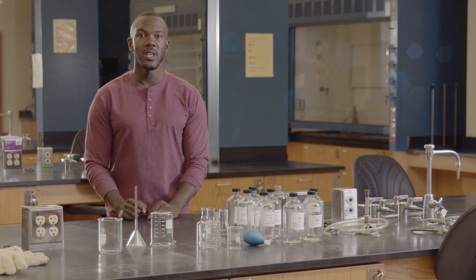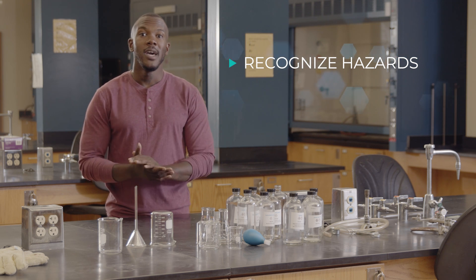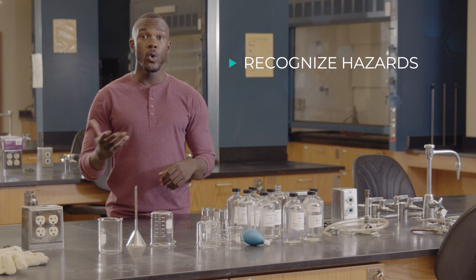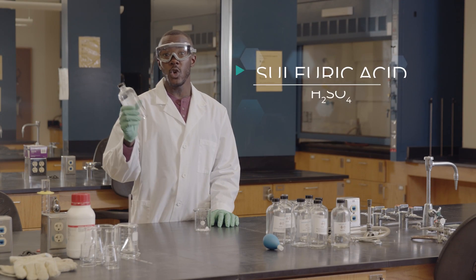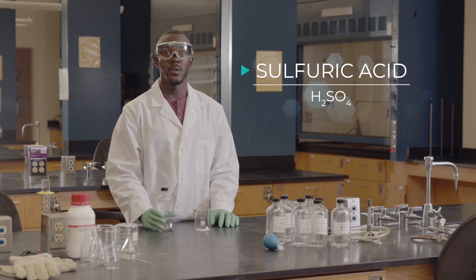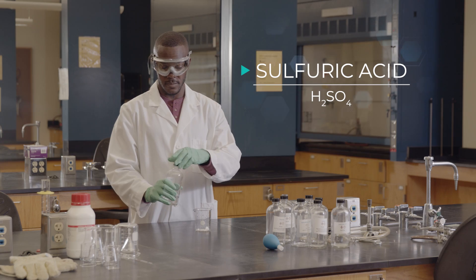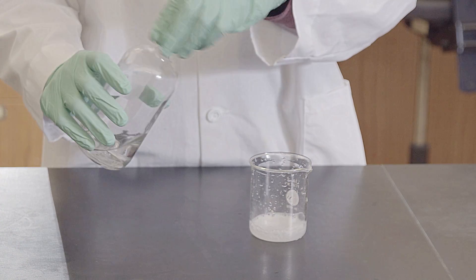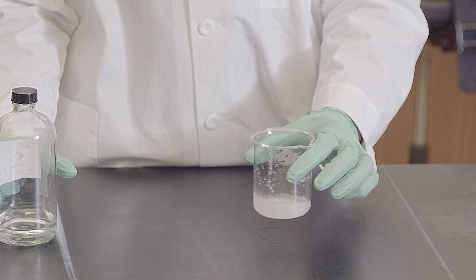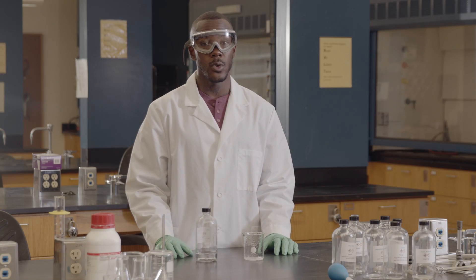The first step is to recognize hazards. Simply put, a hazard is something that can harm you. In the chemistry lab, chemicals are an important source of hazards, but hazards can also arise from equipment and procedures. Sulfuric acid, a strong acid, is an example of a hazard. Sulfuric acid is useful because it reacts with many other chemicals, but it will also react with your skin, causing a chemical burn. The property that makes it useful also creates the hazard.